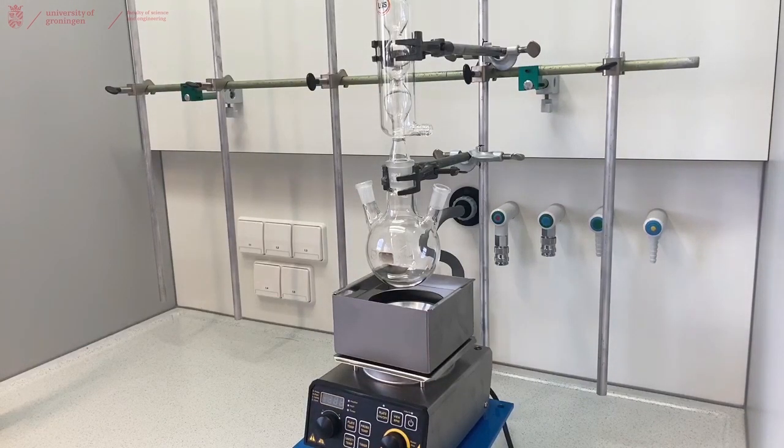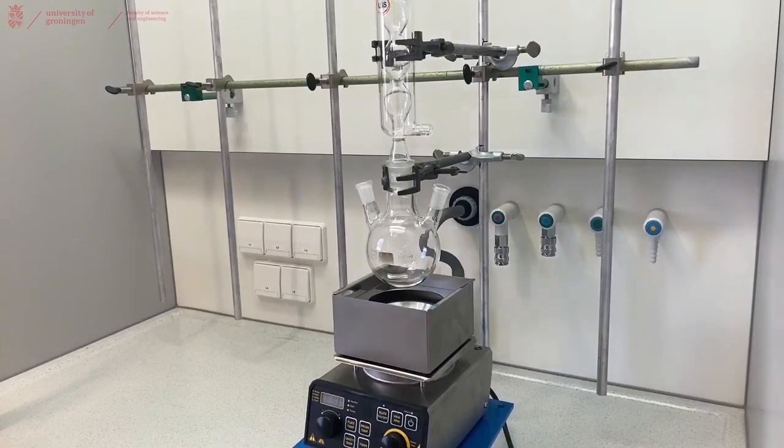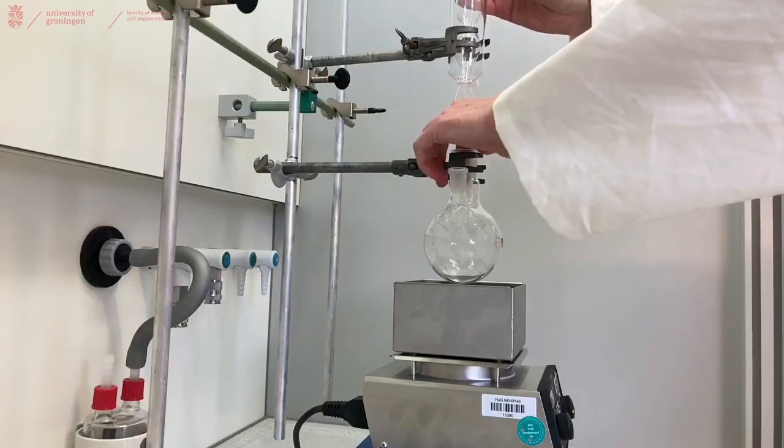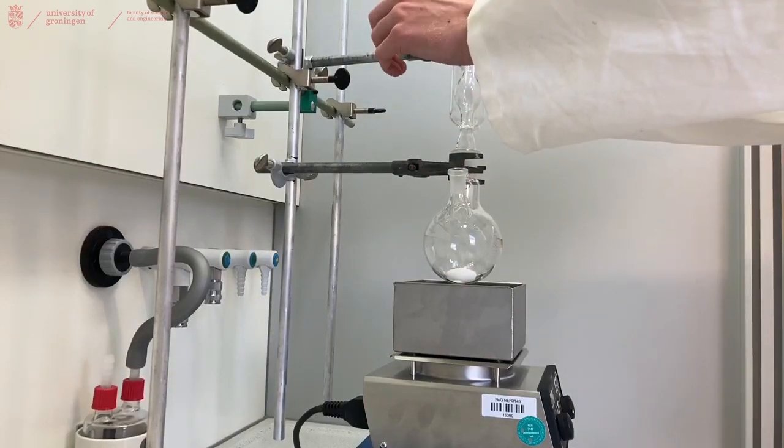Realize you forgot to add the stirring bar to your three neck flask. Put it in and place the cooler back.